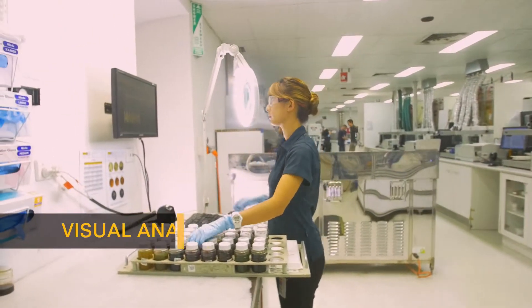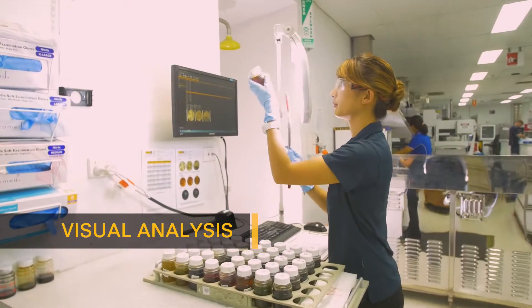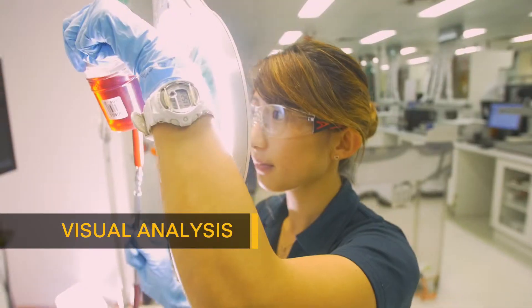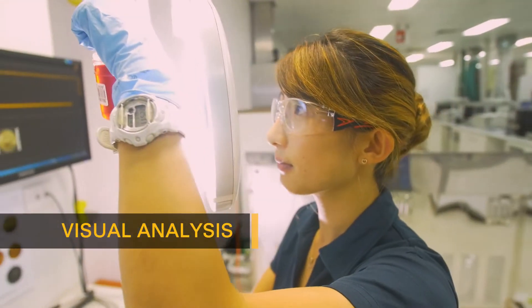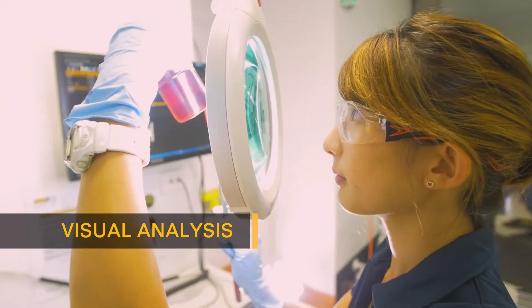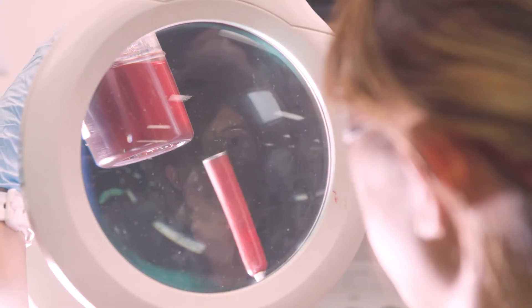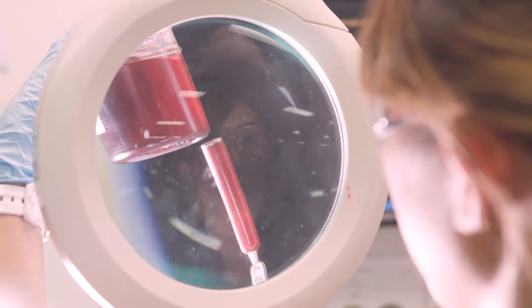One of the first tests we complete is a visual analysis where we're looking to identify any abnormal debris or contamination within the fluid samples.